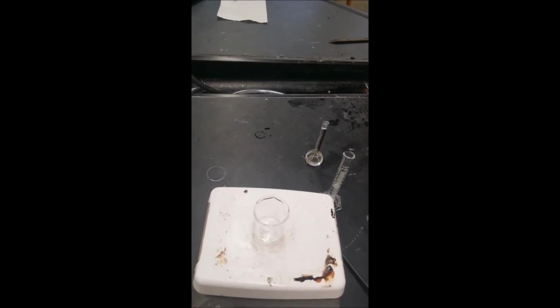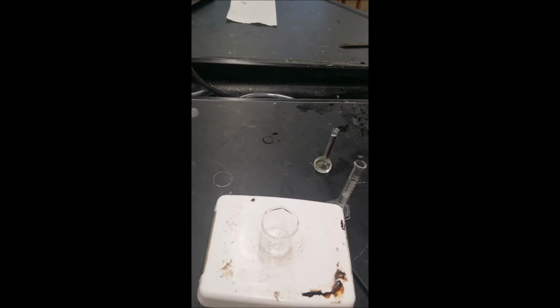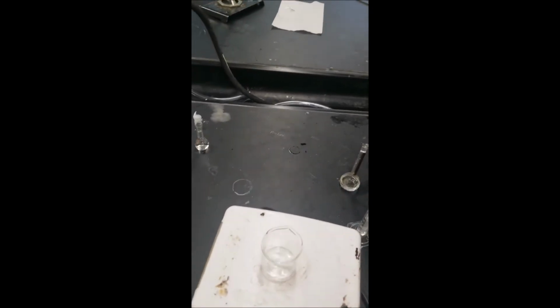The colors are caused by the iodate and the starch. We know that the hydrogen peroxide is our oxidant that helps us undergo these changes, and sulfuric acid is our catalyst. What is the purpose of the manganese and of the malonic acid? We're going to try to look at that.